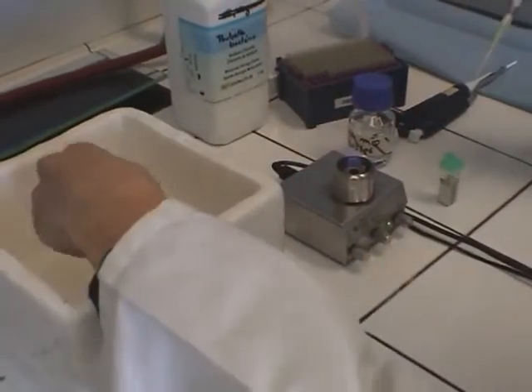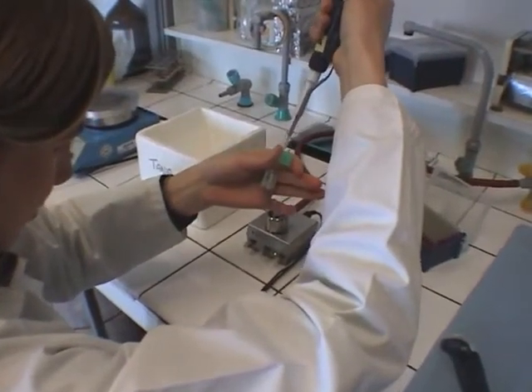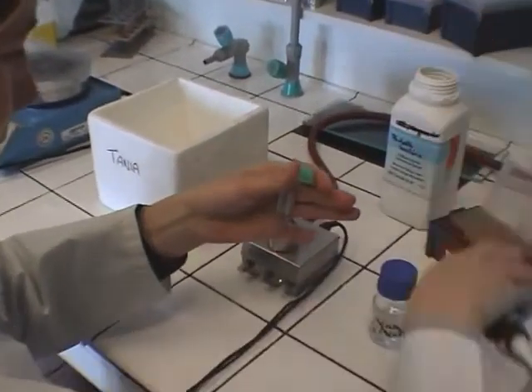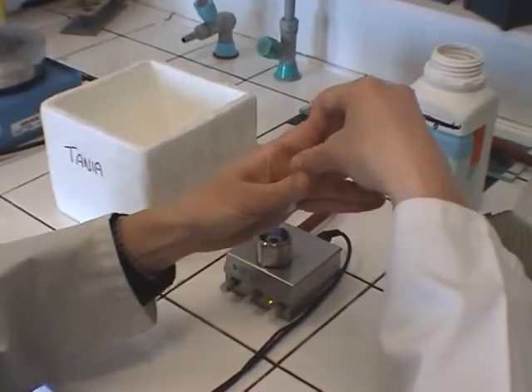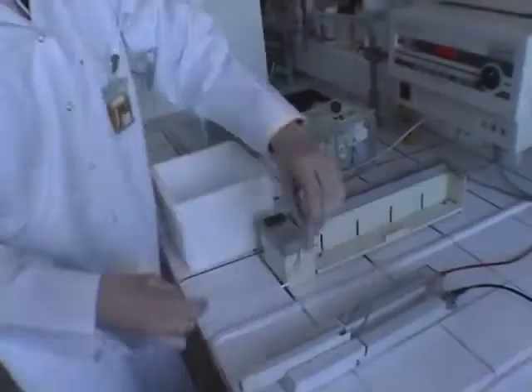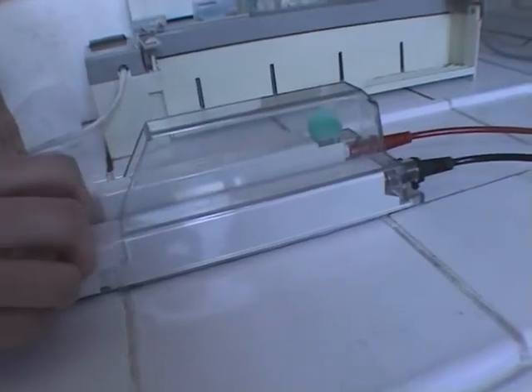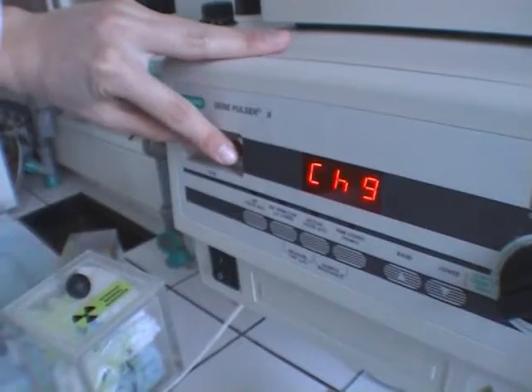Once the gene is cloned inside the plasmid, a solution containing the plasmid is mixed with bacterial cells. A series of electrical discharges at high voltage facilitates the penetration of the plasmid, thus carrying the gene inside the bacteria.